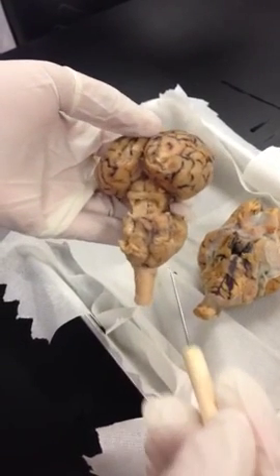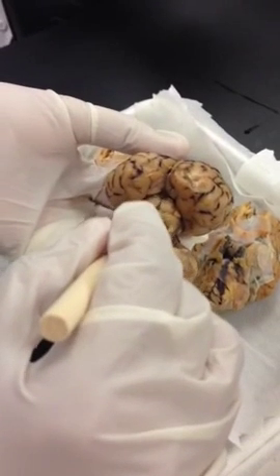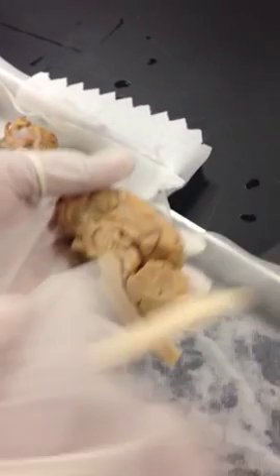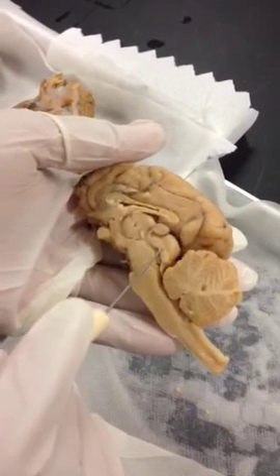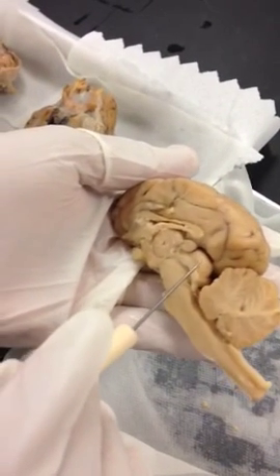Pineal gland. Pineal gland you can find right above the corpora quadrigemina, deep inside. So it's kind of hard to see in that view sometimes. If you see the sagittal view, you can see the pineal gland here right behind the thalamus. And these are again the colliculi in this view.